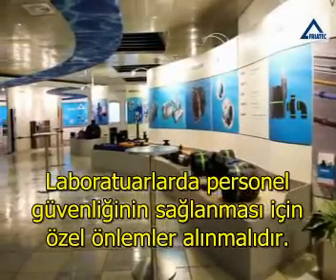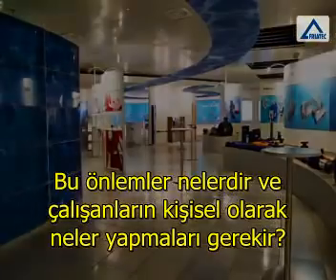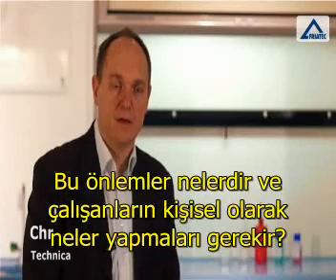Laboratories are places where special precautions must be taken for staff safety. What exactly are these measures and what can individual employees do?